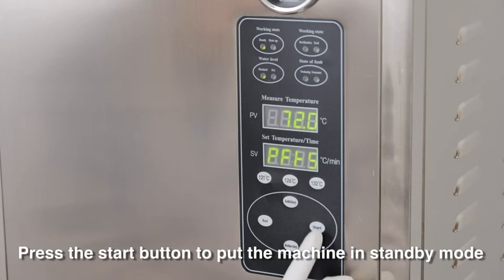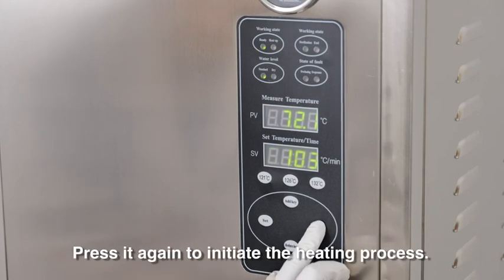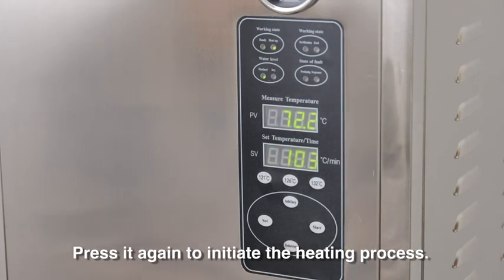Press the start button to put the machine in standby mode. Press it again to initiate the heating process.